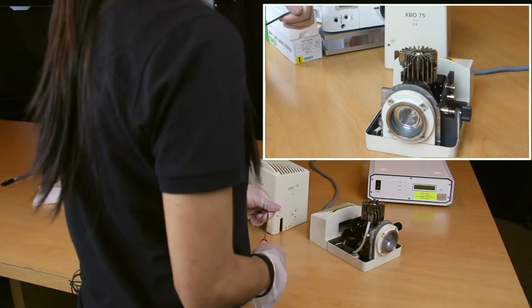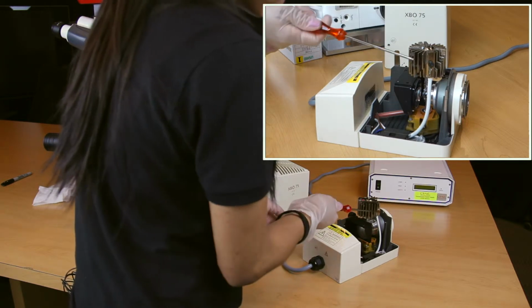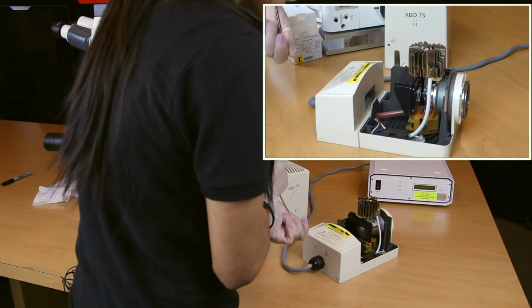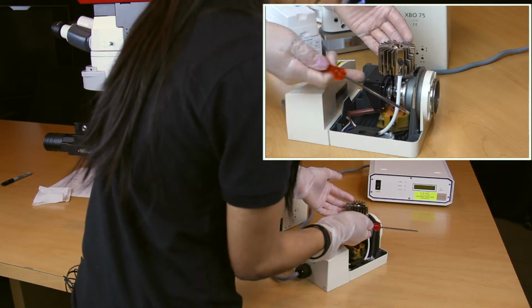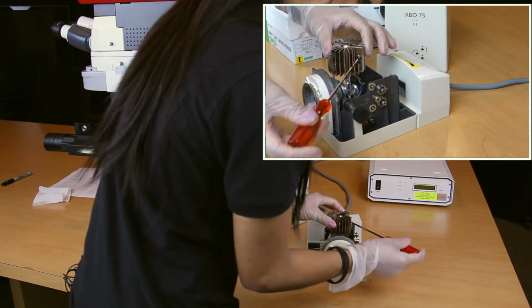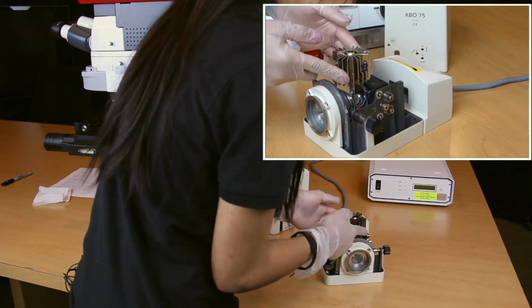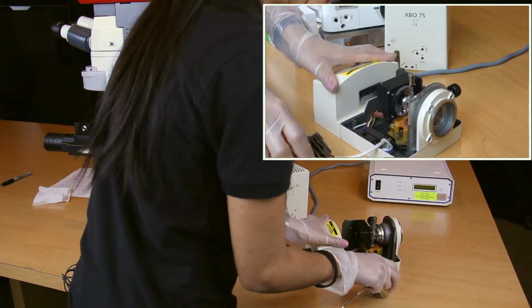And so we have your Xenon lamp housing here. As you can see, there are several components within the lamp housing itself. We have your heatsink, Xenon bulb, and a silver lever that will actually hold the lamp inside of its socket. Prior to handling the bulb, you always want to make sure that you do have your latex gloves on. So what we're going to do is remove the heatsink from the bulb itself. In order to do that, there is another set screw located right here, and you want to take your 3.5 millimeter Allen wrench, rotate this also in a counterclockwise position. Once loose, you want to remove the heatsink from the top of the bulb itself, and just go ahead and set that aside. It is attached by a cable, but just go ahead and set that aside.